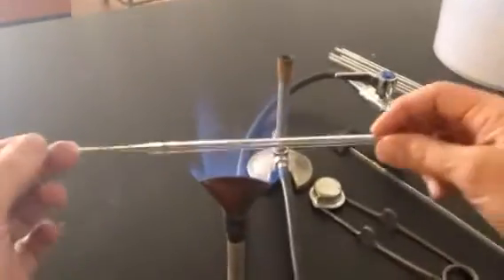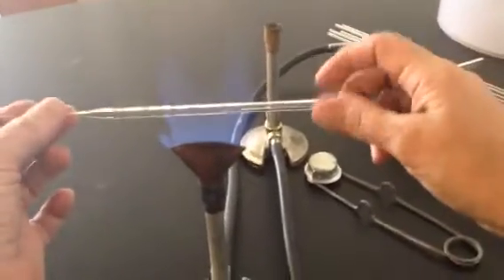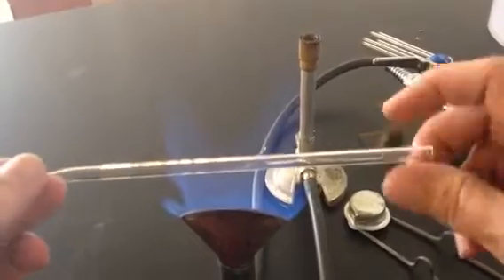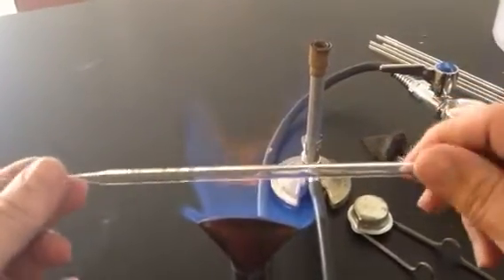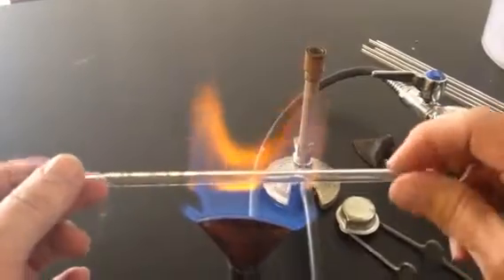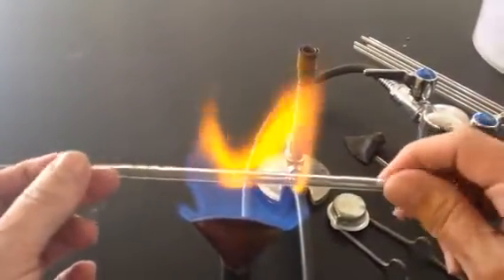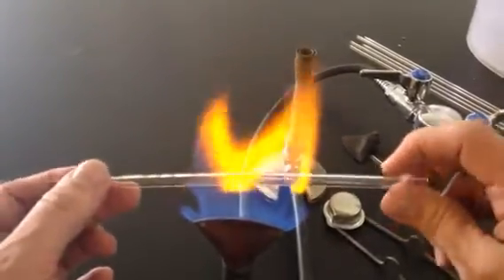And I'm going to take this thing and I'm going to roll it just like I was doing before. But now I'm rolling it in the spread out flame. So it's not as hot, but I'm trying to heat a stretch of glass. Instead of one spot, we're heating a stretch. And yes, your hands are close to the flame, but my hands are not burning. They're just a little warm. It's okay. Once it gets really soft, and you can kind of feel it start to give in your hands, keep rolling it for a little while longer. And then you can just kind of bend it.